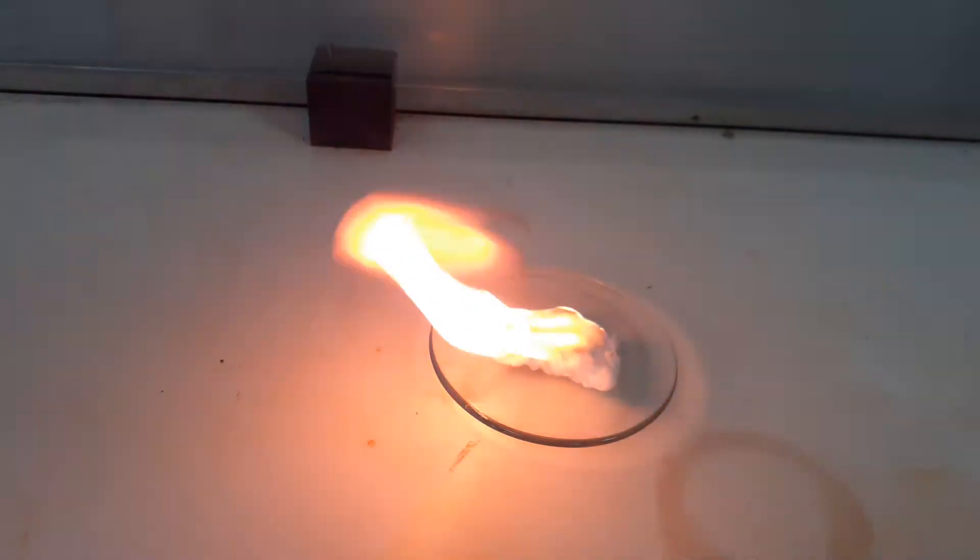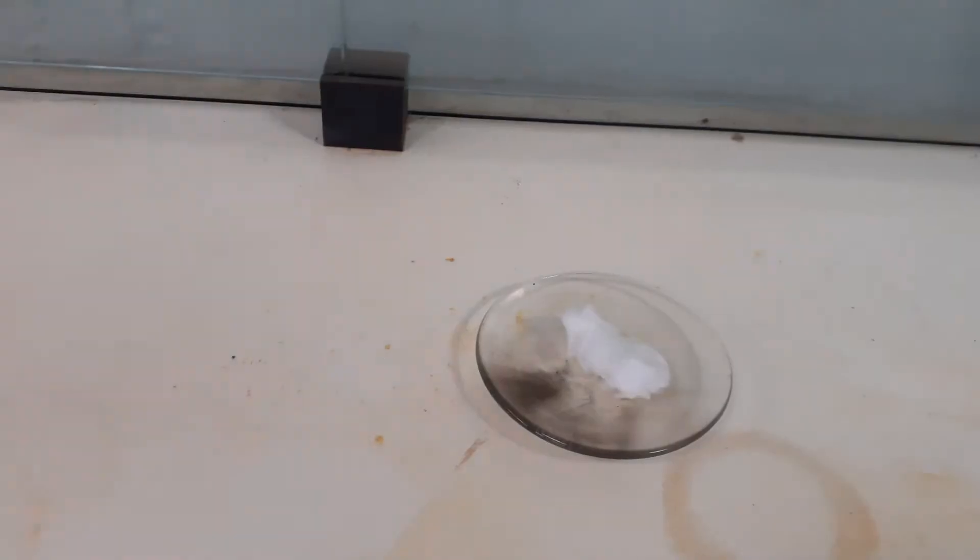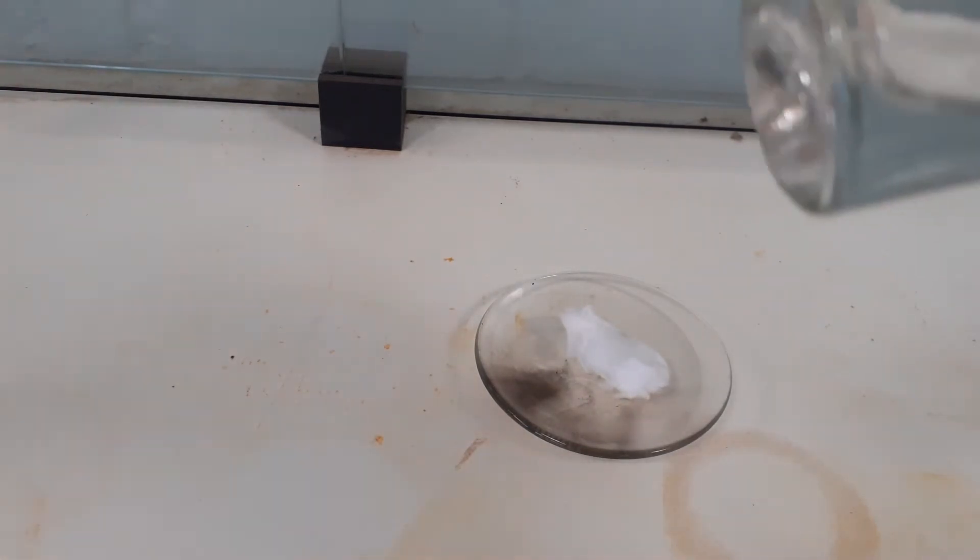Now here is paraffin. You can see this is much thicker, it's not as runny, it's more viscous because the molecules are longer, so there's greater chance of them entangling with each other. Now let's look and see how this burns.